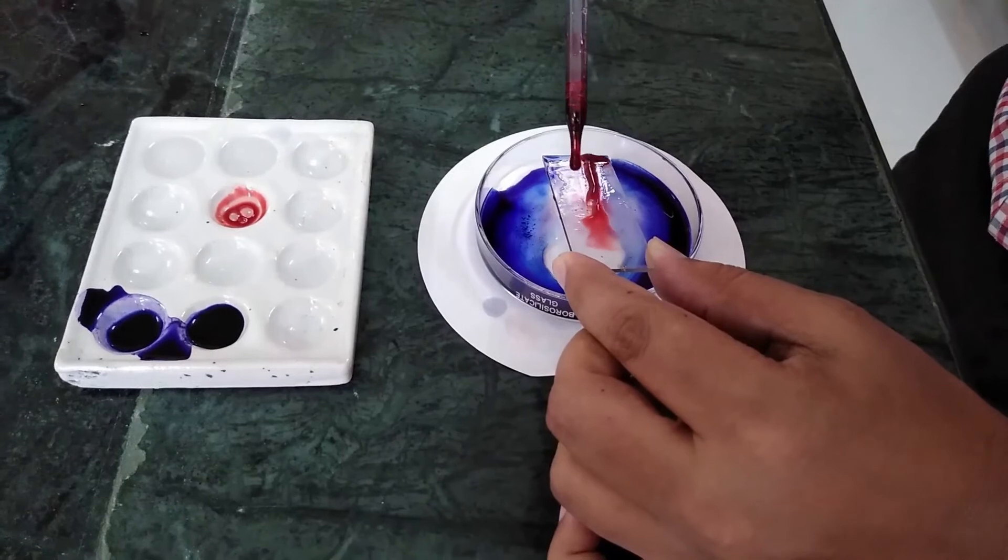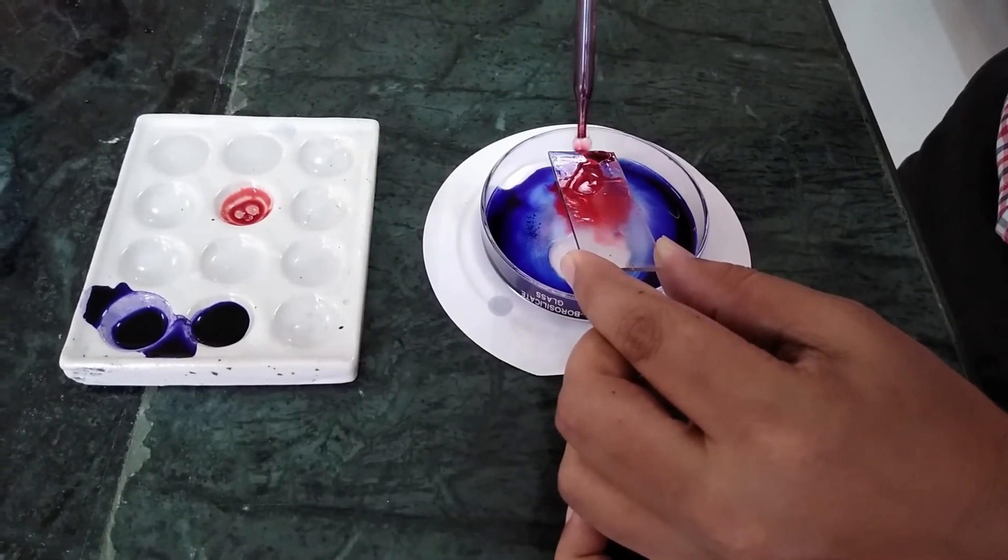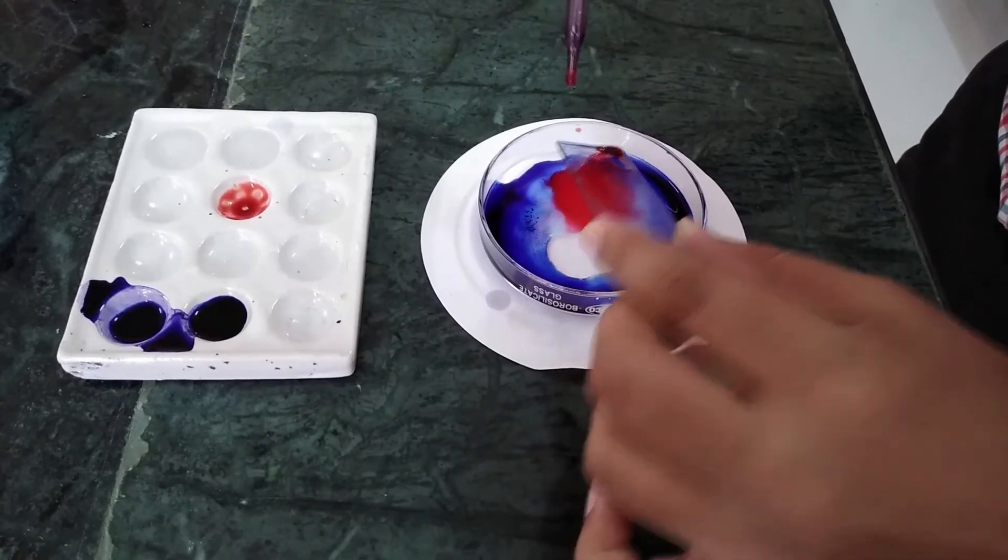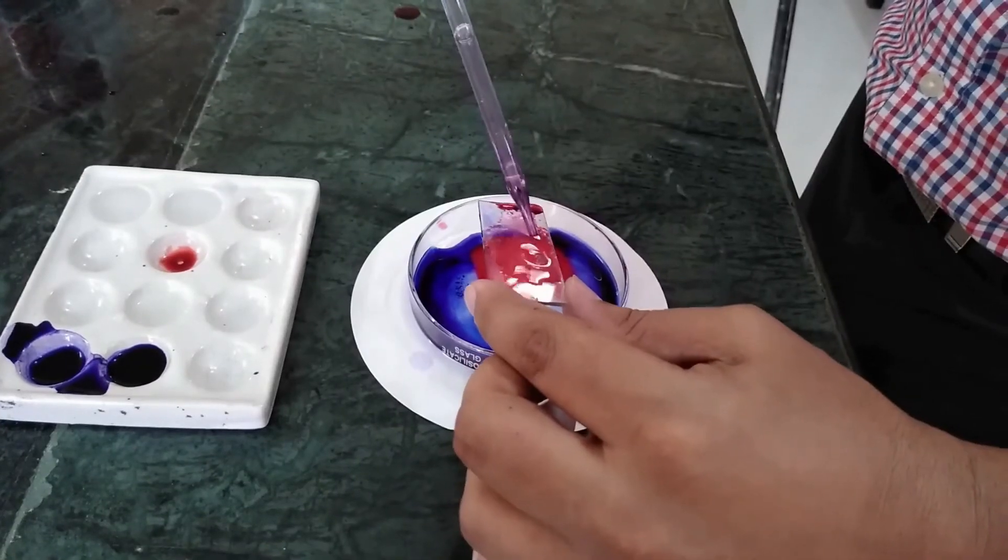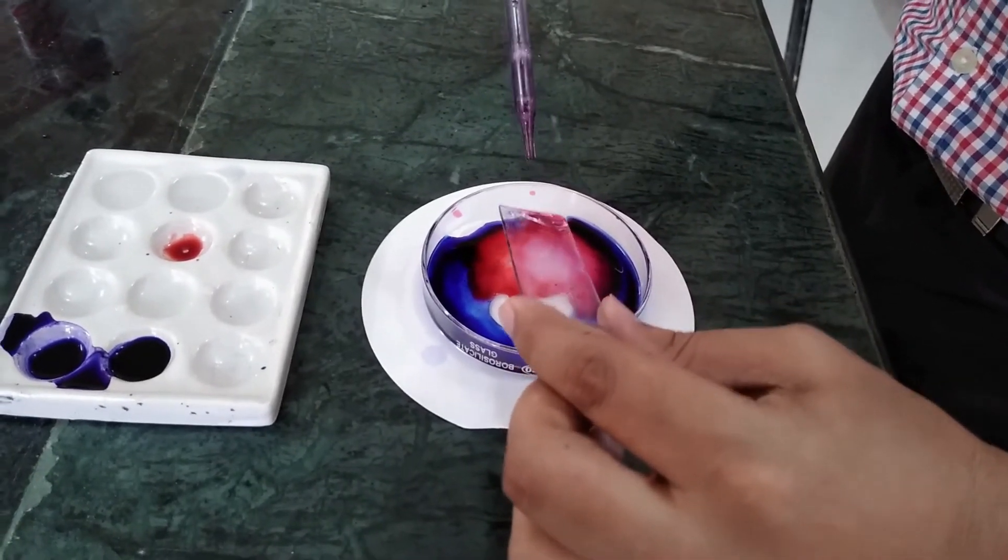After that, the slide is counter stained with safranine. After that, again, the slide is washed with clean water.